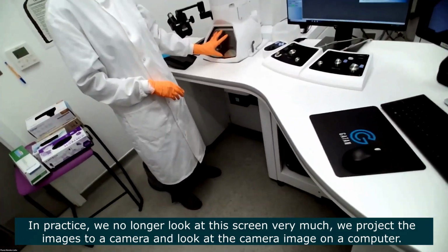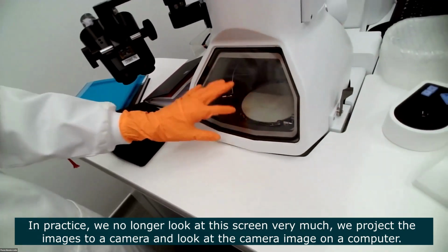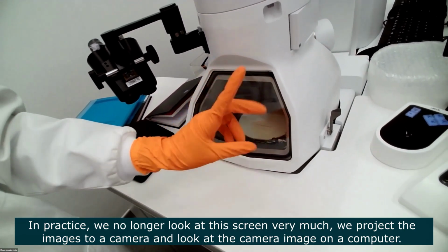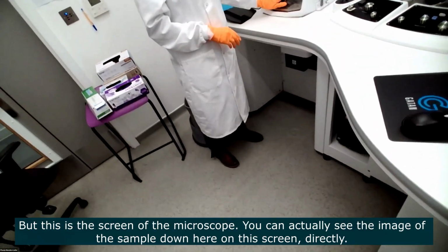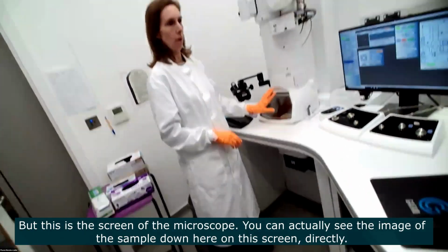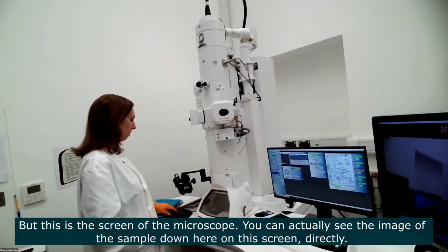In practice, we no longer look at samples here very often. We then go to the camera, we project the images to the camera, and you will see that. But this is the screen of the microscope, where we can actually see the sample down here on this screen.